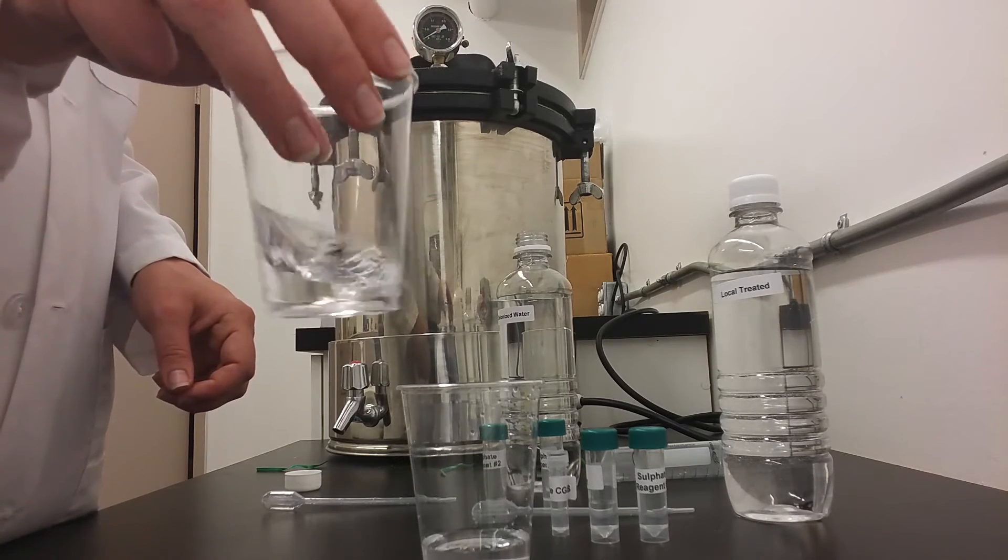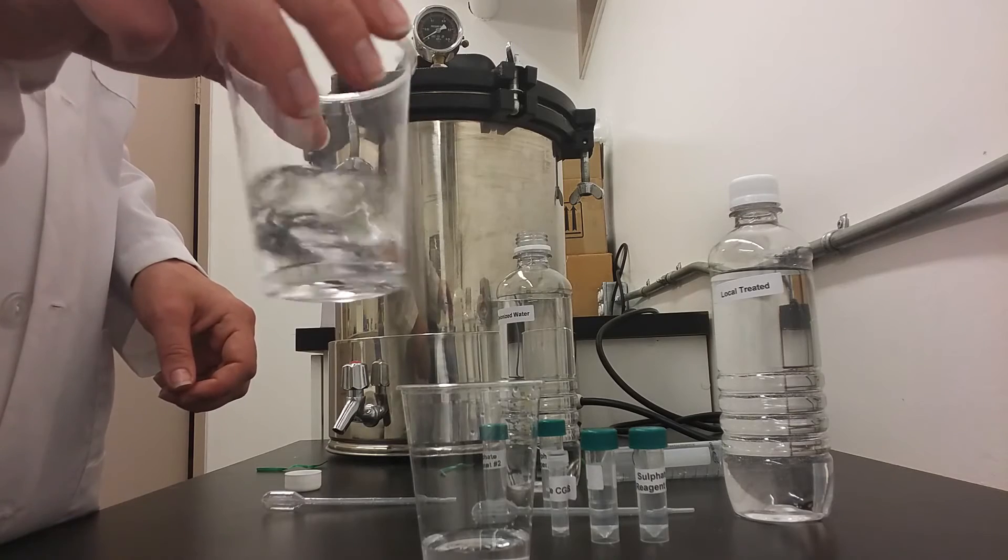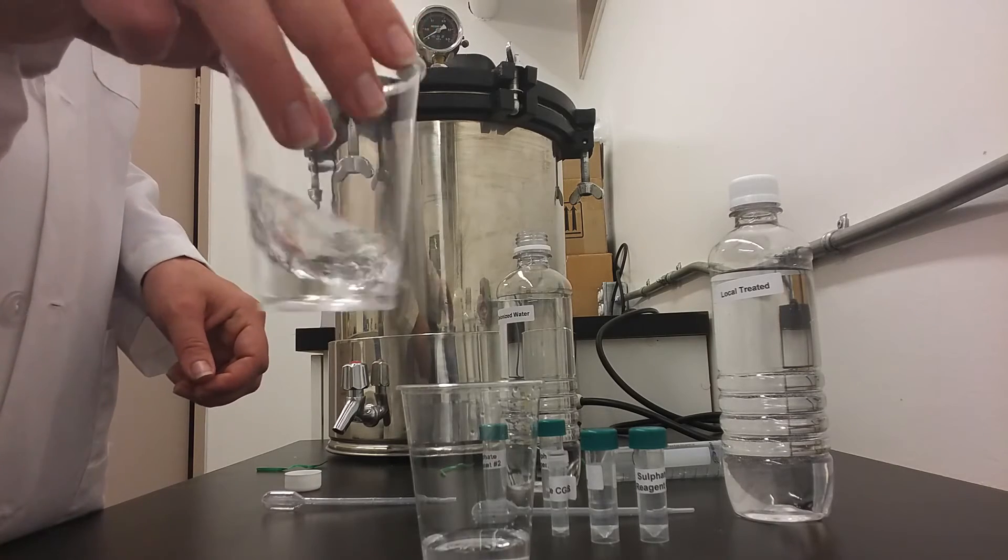And move onto your cup of water filled with the treated water sample from your local source.